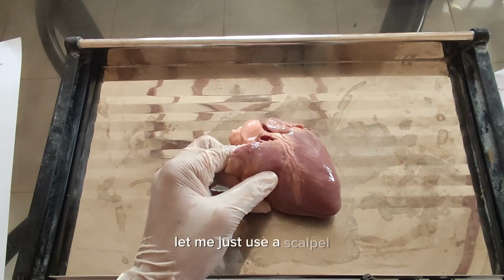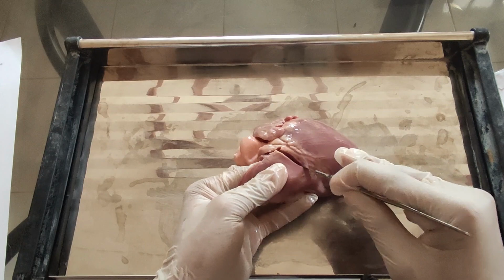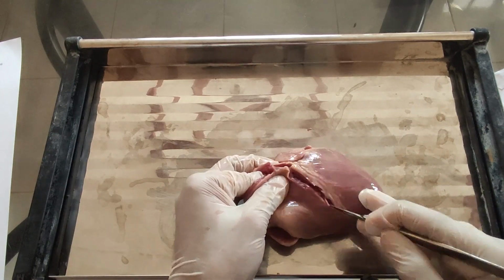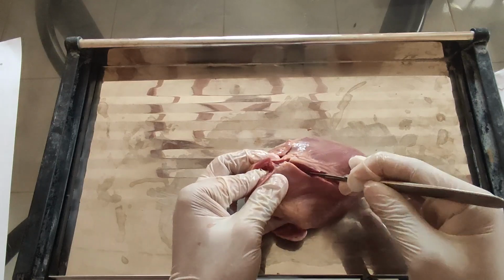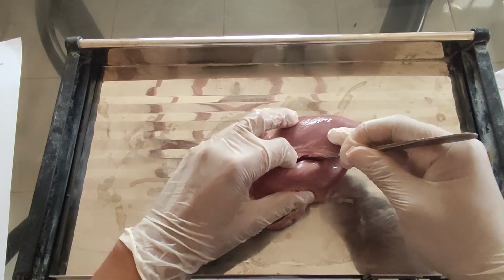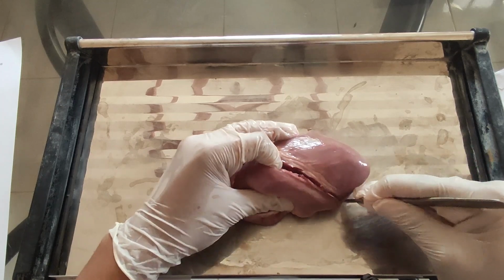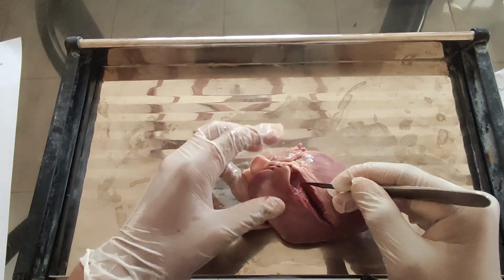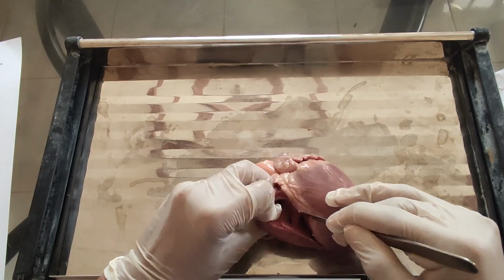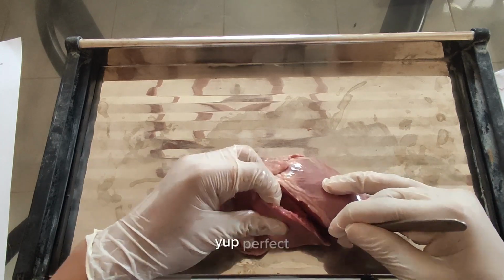Let me use the scalpel. Now begin our opening to it. Yep, perfect.